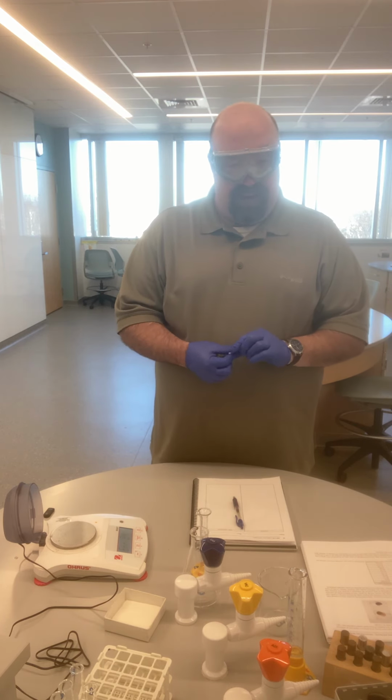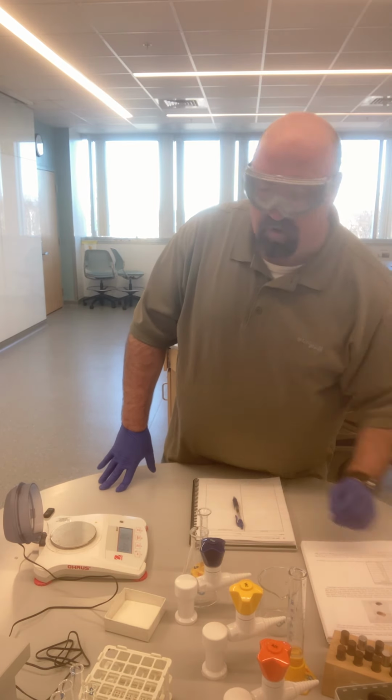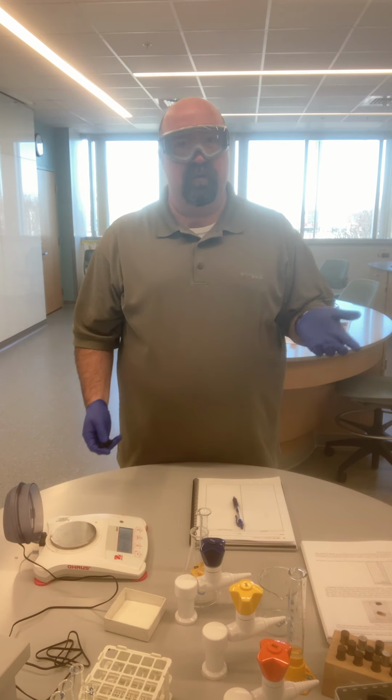And that really takes us to the end of just sort of this beginning part of Module 0, just sort of introducing you and showing you some of the common tools that we use in a chemistry lab.